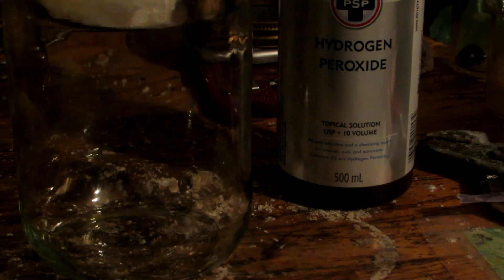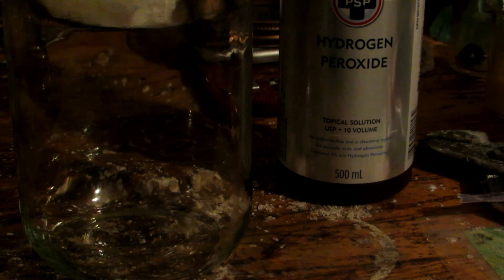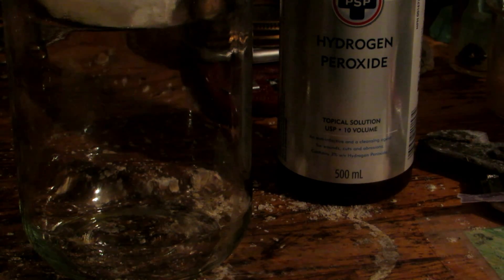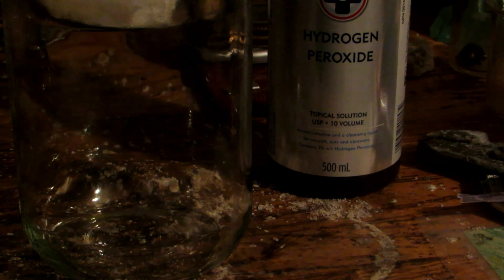This is just 3% hydrogen peroxide. 30% would be much more useful for other applications, but 3% works here since concentrated hydrogen peroxide is a lot more expensive and we wouldn't want to waste it when 3% will do. This was just bought at the pharmacy, and the hydrochloric acid was bought from Canadian Tire.